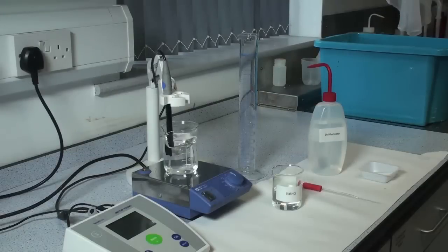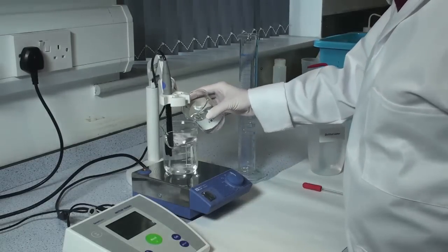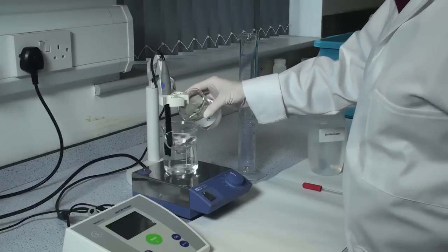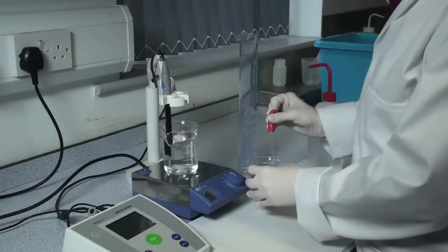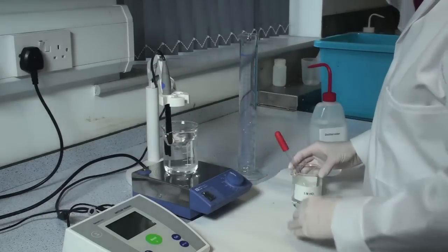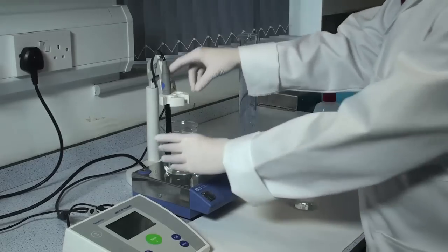Adjust the pH to 5 with 5 molar HCl, and then adjust the volume to 200 mls with demineralized water.